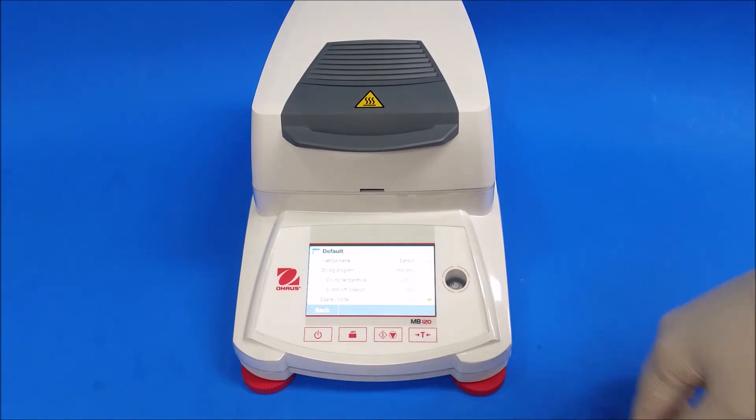Right now they were on default settings. That's why I changed them, since it was going to take too long because it was set on 10 minutes.